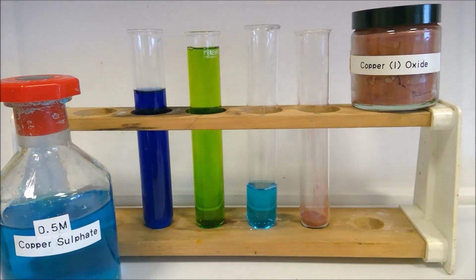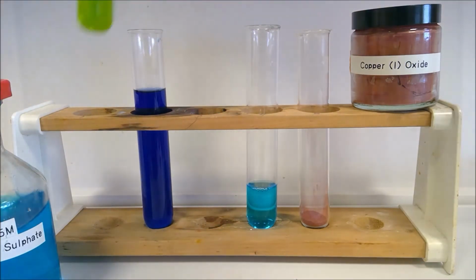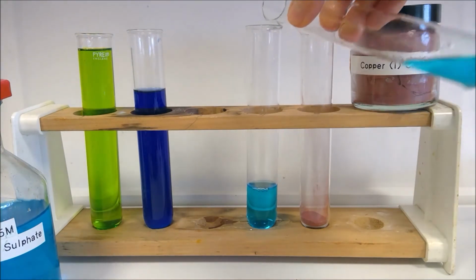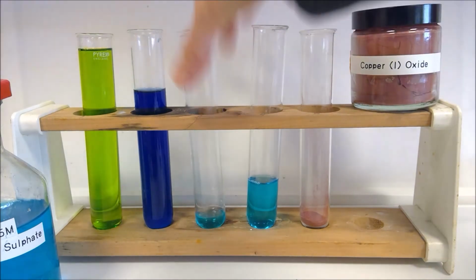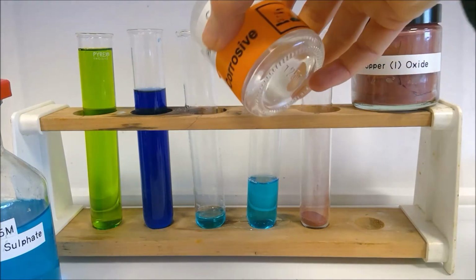Okay, so we've got a little bit of graduation of colours all the way through there. So have a think about what colour you're seeing and why that is the case. Now I'm actually going to try and repeat this one again for you, just with a much smaller amount of our copper sulfate to start with. I'll pour a bit more of that out, just to see if we can see the full change that you might have been expecting here.